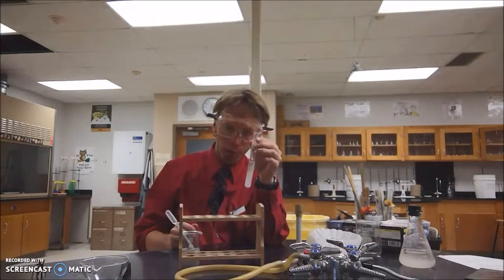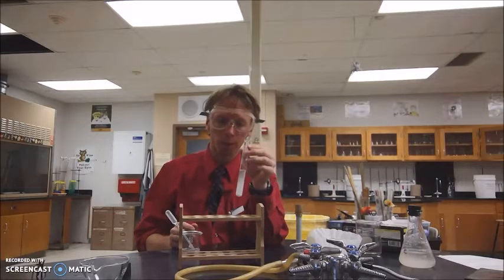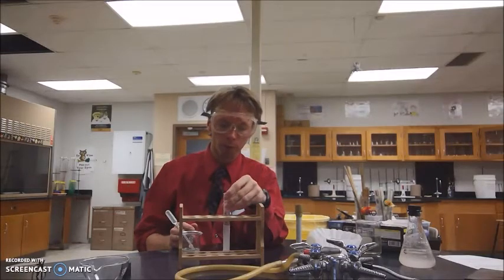And you're going to take your plastic pipette and add a small amount to the mixture, and some sort of change should be very apparent. And we'll set that aside for a moment and let the change finish out.